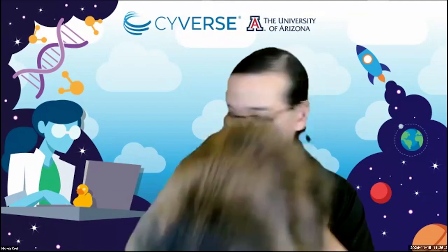Basically, once you do your final push next week, we'll be able to select it if we just type Seurat. I've meant to give more information to him and to you at this point, but what I'm trying to do now is containerize a lot of the tools that people are asking for into a single container.